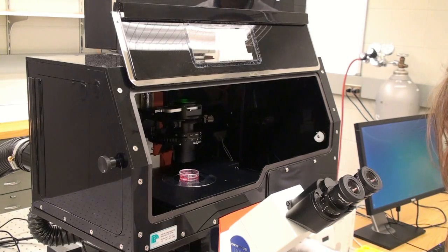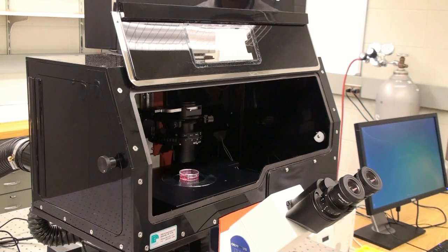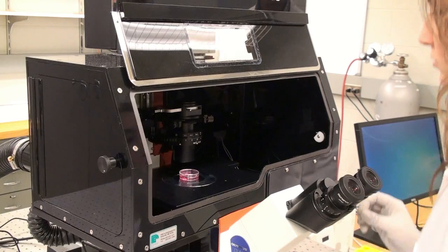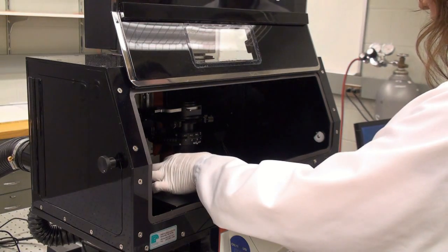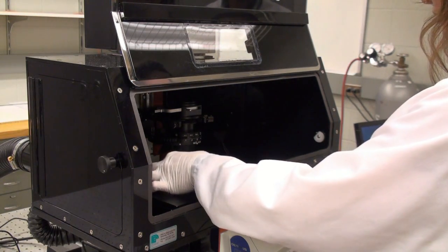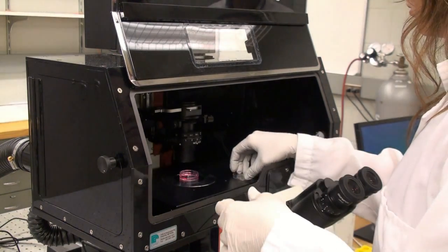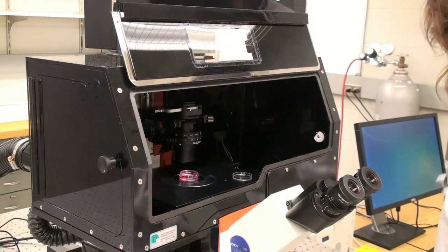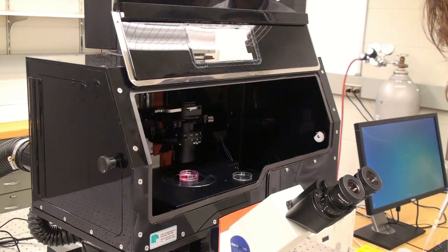This will give us the bead image under full force condition. Next, we will dissolve the cytoskeleton of the cells using SDS solution. This will ensure that all the cells are removed and the beads are relaxed to their original position.